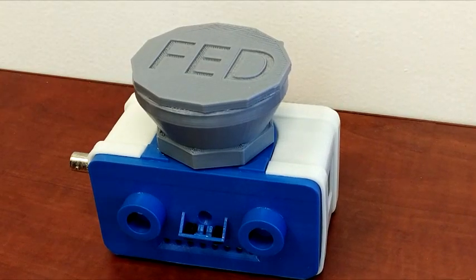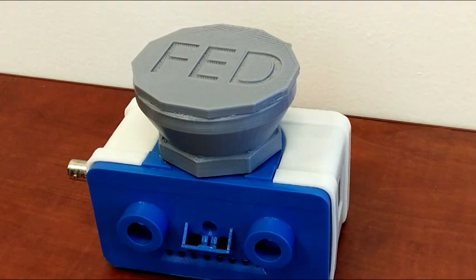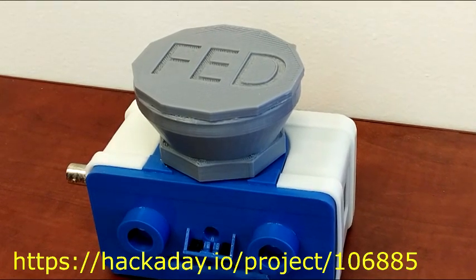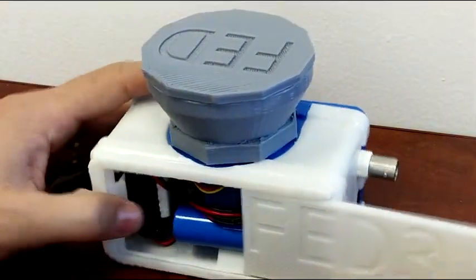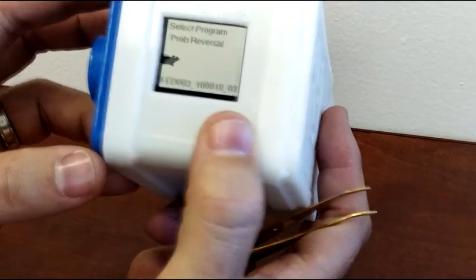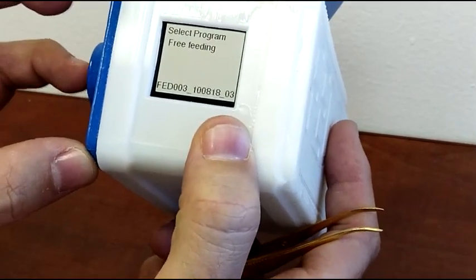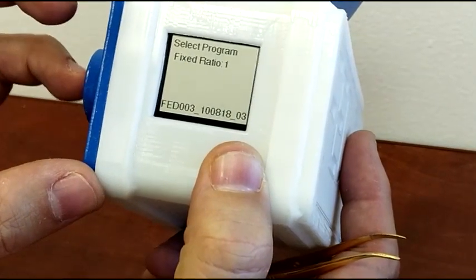In this video, I'm going to demonstrate the different behavioral programs that FED3 can run. All of these programs are included in the FED3 code on the Hackaday page, and custom programs can also be written. When I turn FED on, it's a power button in the back, it starts up on a program selection screen. I can poke left or right to scroll through the programs that are on FED.